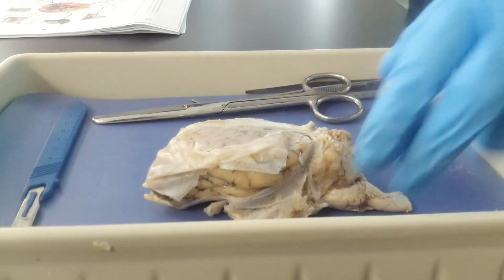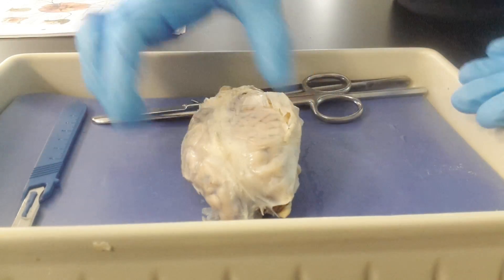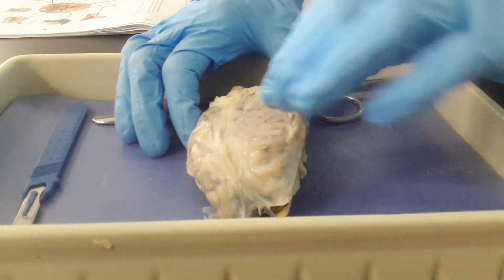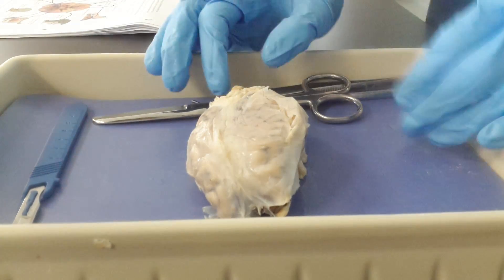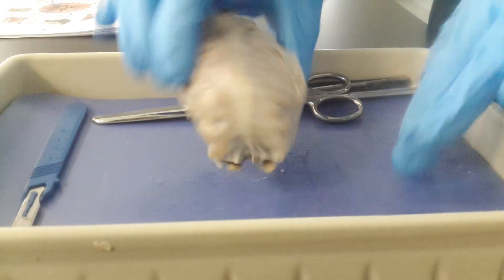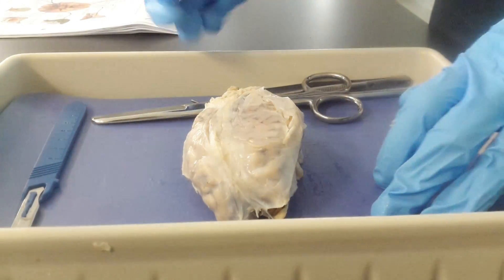Today we're going to go ahead and dissect a sheep's brain, which is actually very similar to the human brain. We'll be able to see a lot of the same structures that we see in a human brain, just in a little bit smaller of a scale.